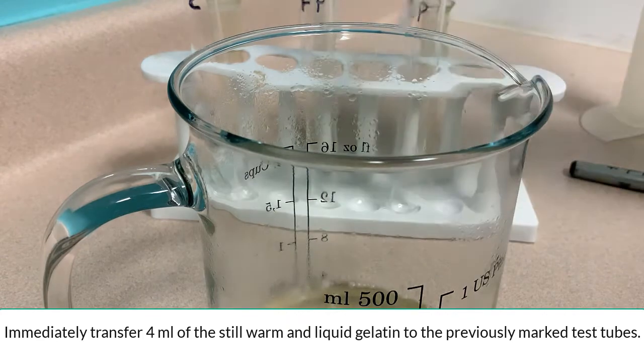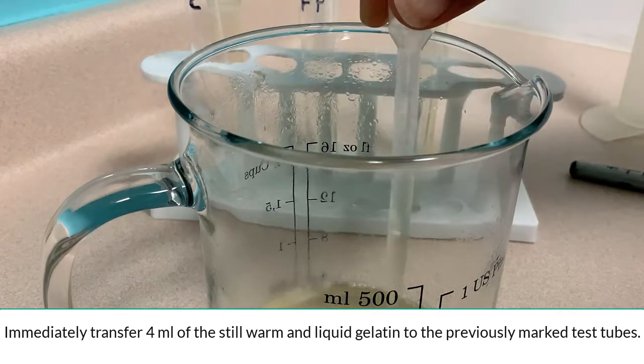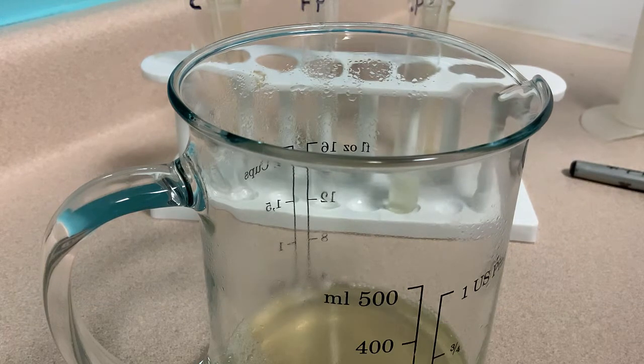Immediately transfer 4 milliliters of the still warm and liquid gelatin into the previously marked and labeled test tubes.